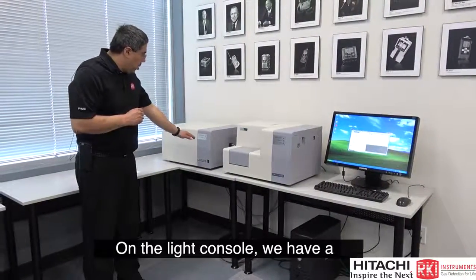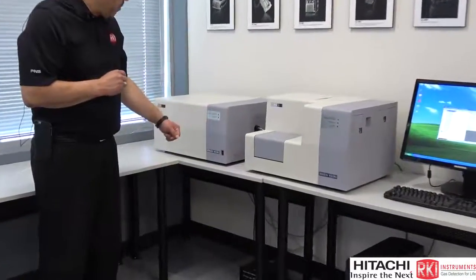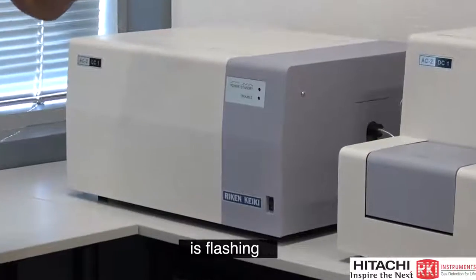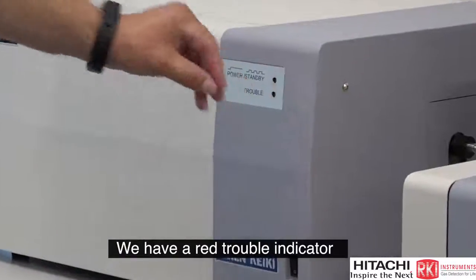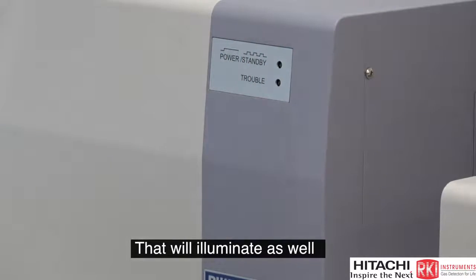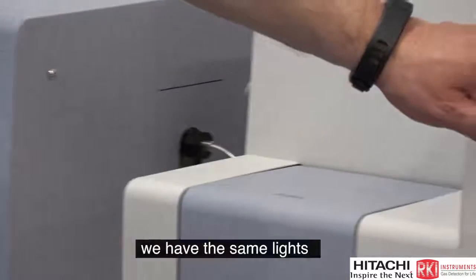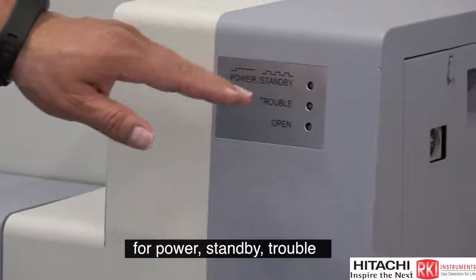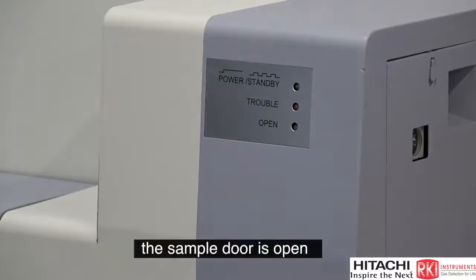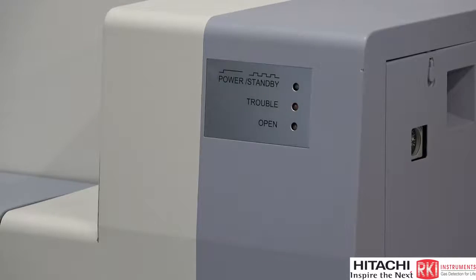On the light console, we have a couple of status lights. Basically, power, steady on, and standby or warm-up mode is flashing. We have a red trouble indicator. Should the system ever encounter a trouble condition, that will illuminate as well. On the detector console, we have the same lights for power, standby, trouble, and in addition, an open light, which illuminates whenever the sample door is open.